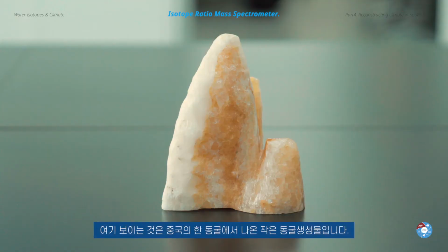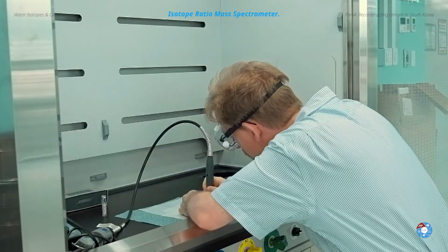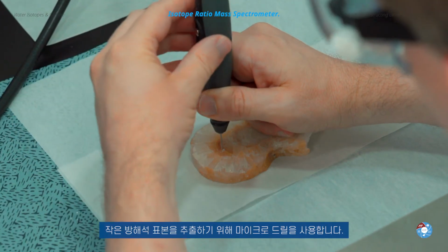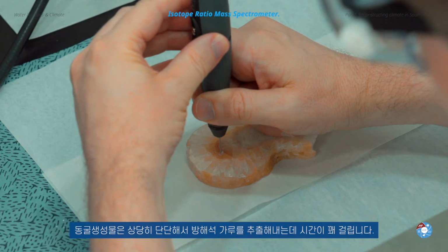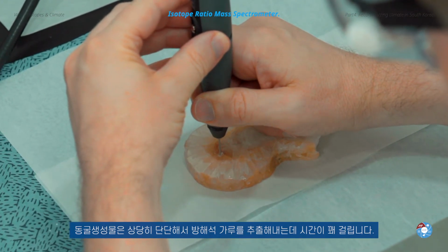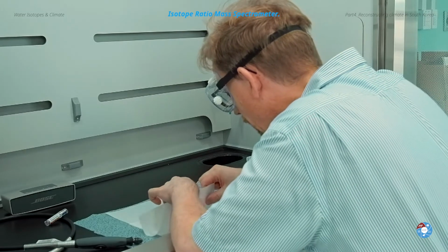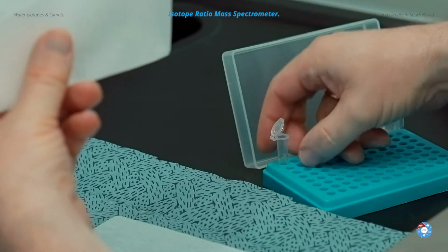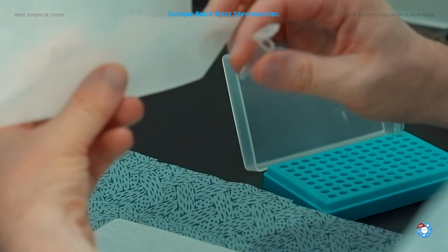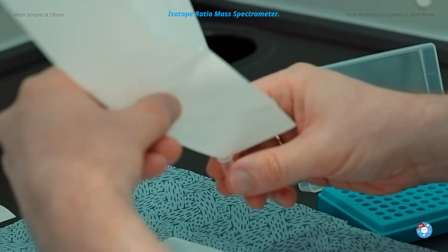What you see here is a small speleothem from a cave in China. To extract small calcite samples, we take a microdrill. The speleothem is quite hard, so it takes quite a while to drill out enough calcite powder. The powder is then filled into a small vial.